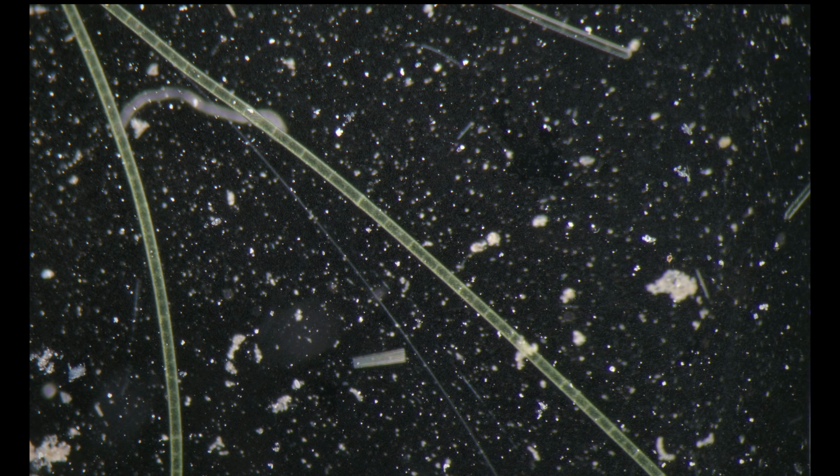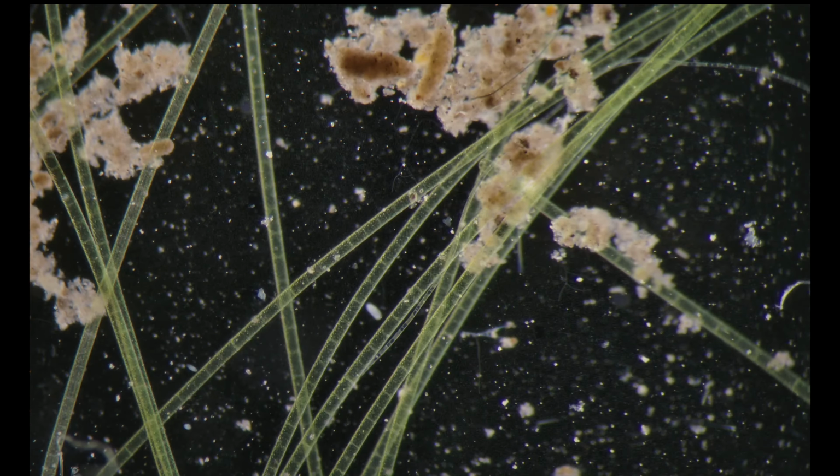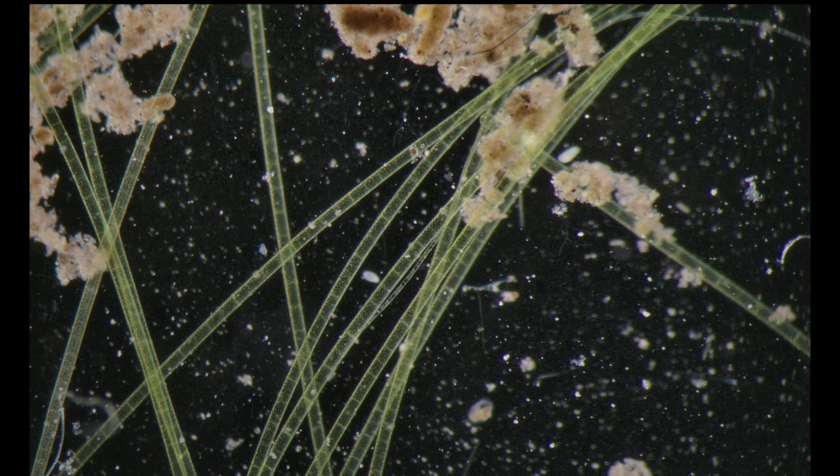Okay, so what are we doing in the dish? When I take a sample, I usually don't use a plankton net. I don't like using a plankton net because you can't take from a specific source like benthos or the upper part. Some of the specimens are of course going out with the water, and a lot of them are dying.